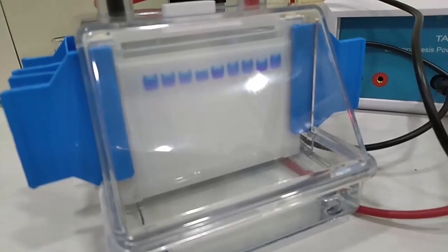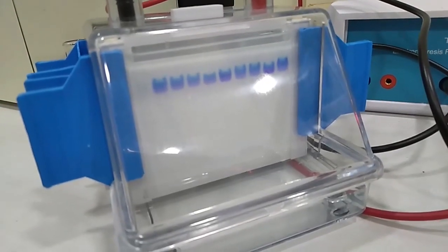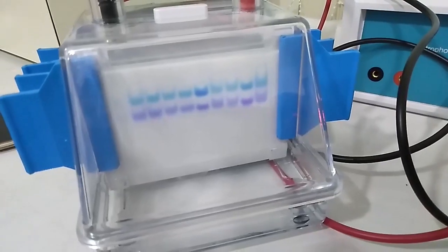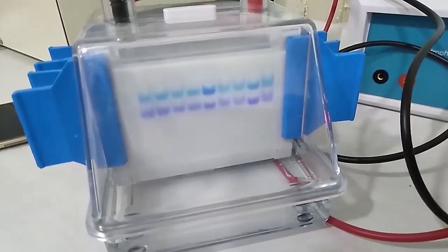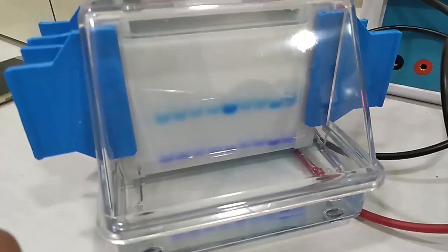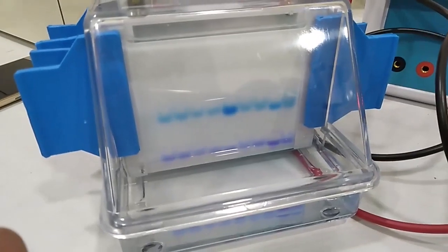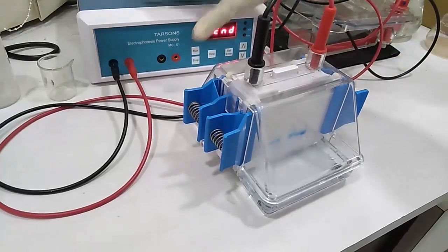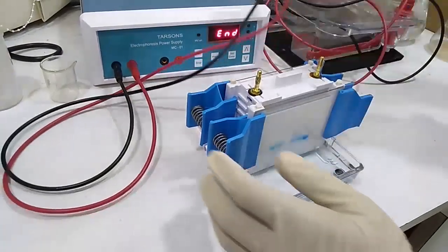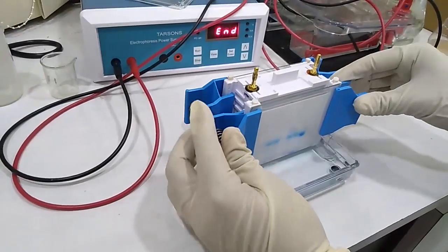Now you can see the gel is already start to separate themselves. Now you can see the separation of two colors. So this is time to stop the machine. And we have stopped already. And now I will open the cap and open the clips.